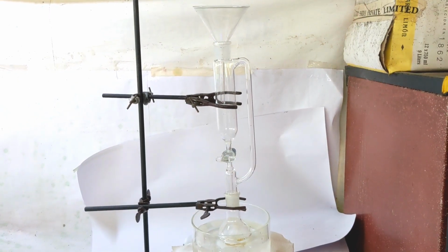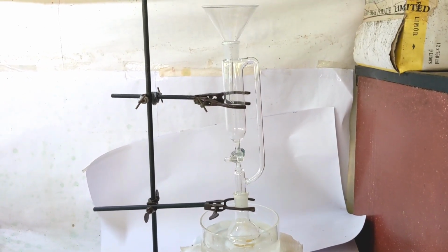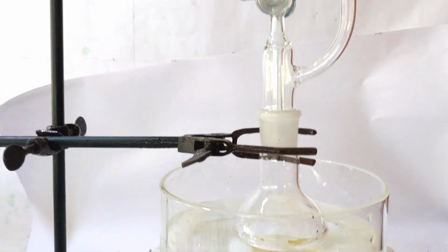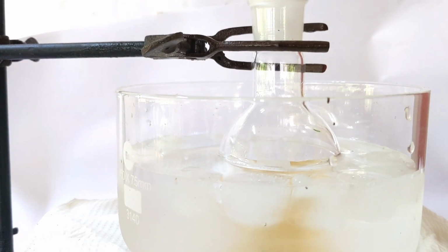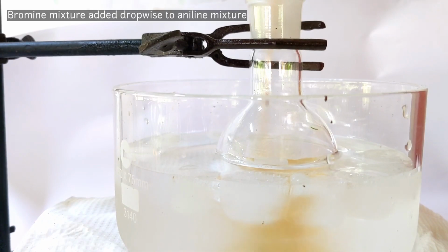Now set up the flask containing aniline in an ice bath with a separatory funnel on top. Bromine in acetic acid mixture was added to the separatory funnel, and with continuous stirring, the bromine acetic acid mixture was added drop-wise to the flask.